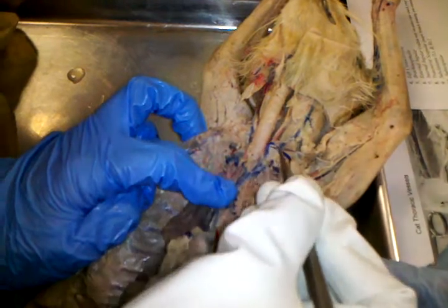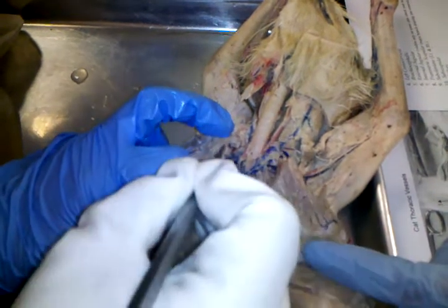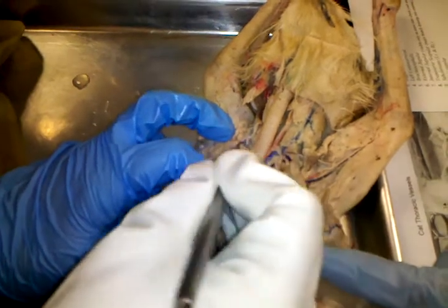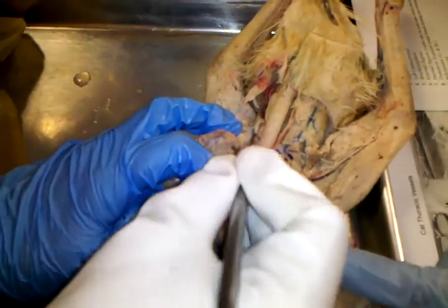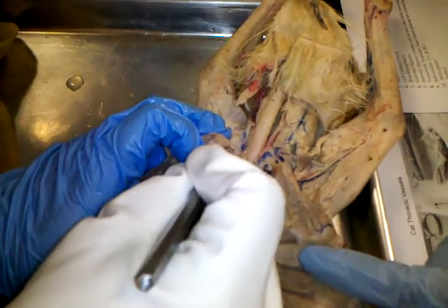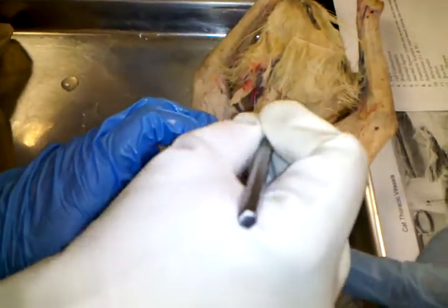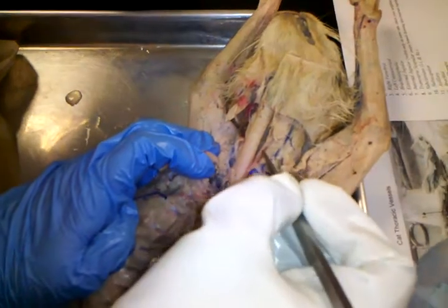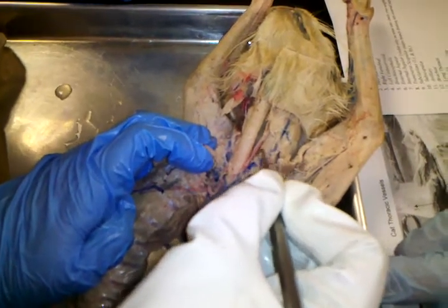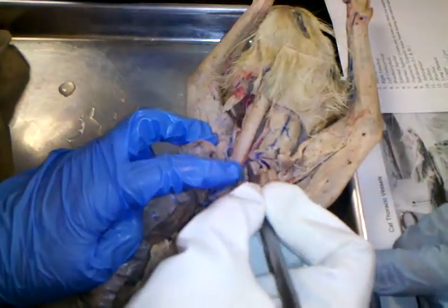A major thing that comes off is called the jugular. This is the external jugular here. Here, this got broken, here's the external jugular on this side. And sometimes you can see an internal jugular, and sometimes you can't. In your case, let me see if I can find an internal jugular. Yeah, we were looking for that and couldn't find it. There's certainly nothing on here that shows up very good. Sometimes you'll have a cat, though, that'll have it even. I mean, the internal and external will be about the same size, but that's unusual. Usually it's this pattern. I don't see an internal on yours, which is not terribly uncommon.